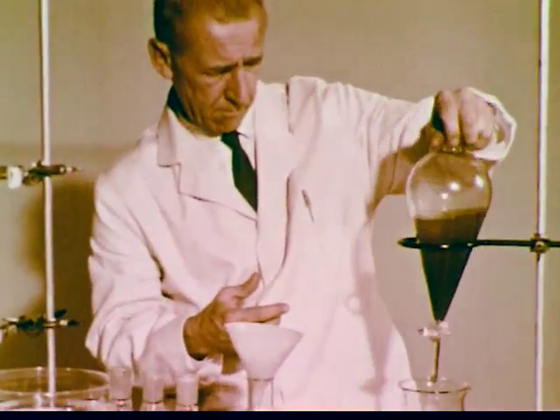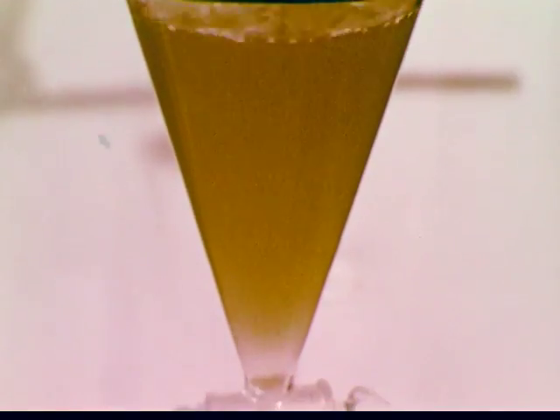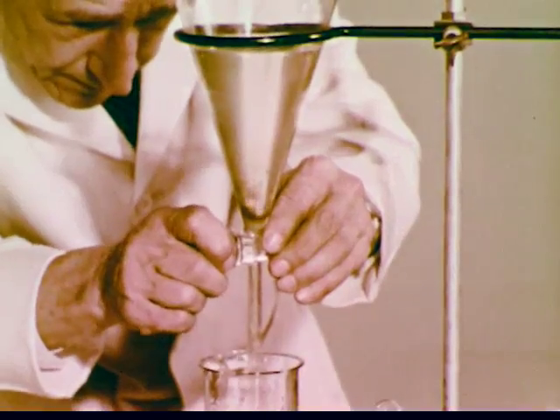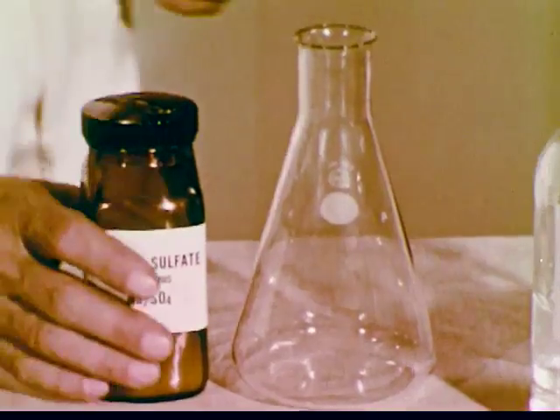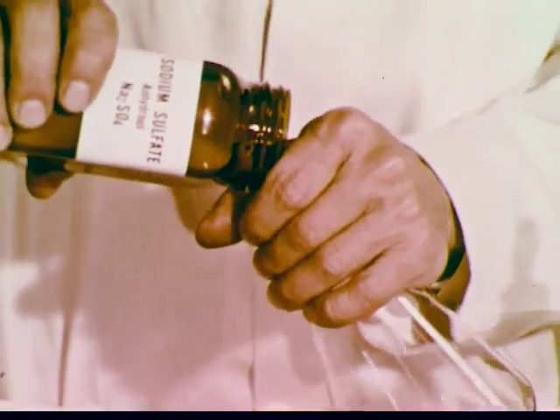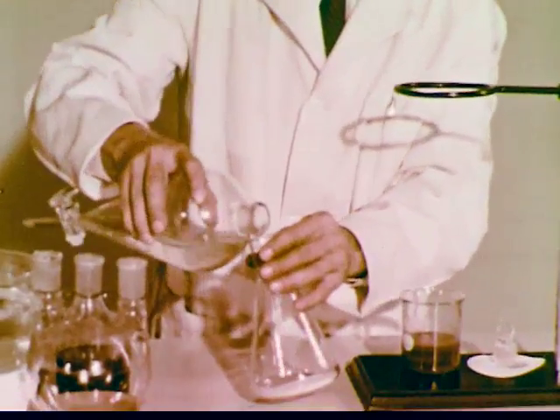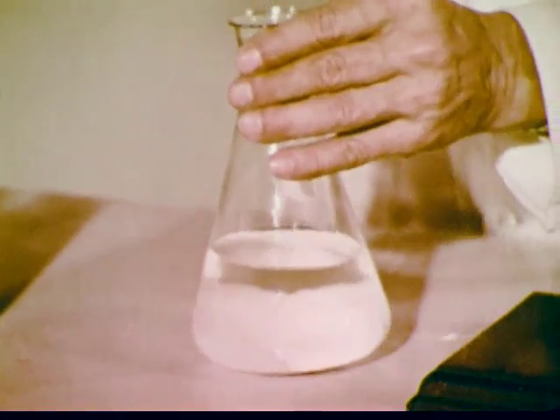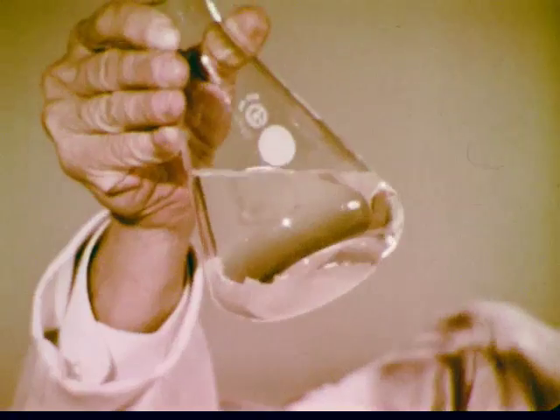The layers are again separated. Distilled water is now added and thoroughly mixed. Repeated washings of this kind remove any traces of inorganic ions and yield a nearly clear liquid. After the final water wash is withdrawn, the remaining ether solution still contains traces of water from the washing operations, as the cloudiness indicates. Anhydrous sodium sulfate is added to the ether solution and absorbs these traces of water. A clear, dry solution of ether and ketone remains, which will be separated by distillation.